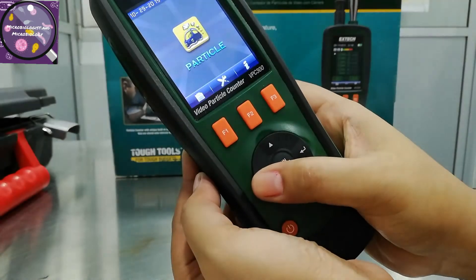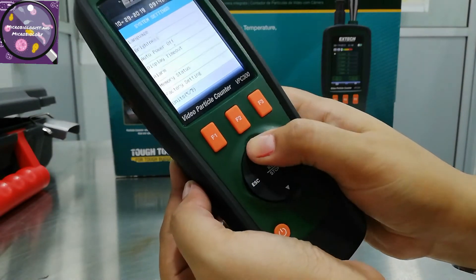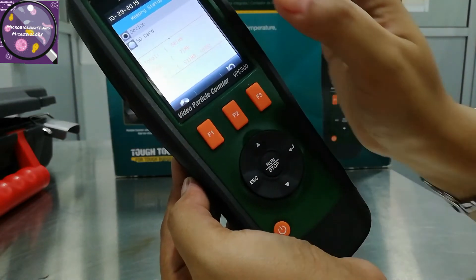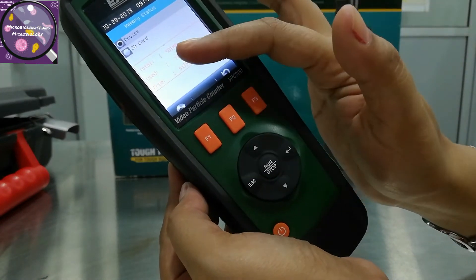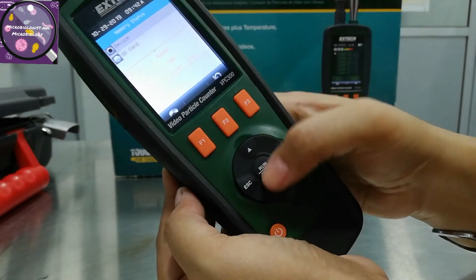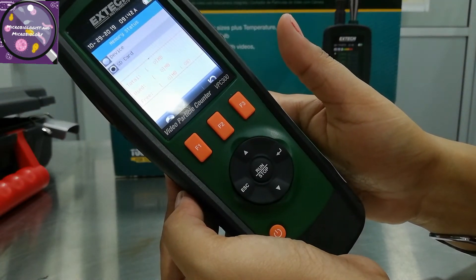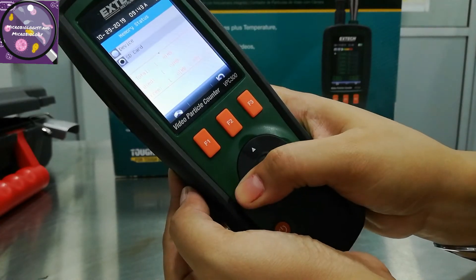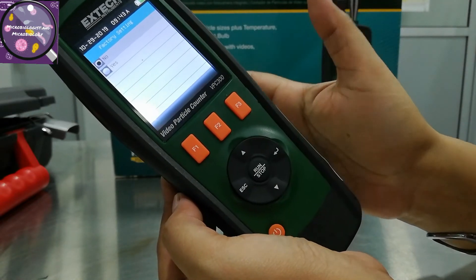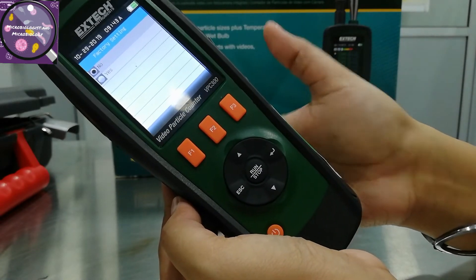The next one is the memory status, where we choose between the device or the SD card. Yes, this particle counter also has an SD card option, because it takes pictures and videos, so it requires proper GB data to store pictures, video, and particle count data. There is also a factory reset setting — if we select yes, all data will be removed.